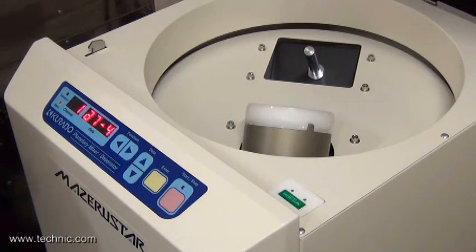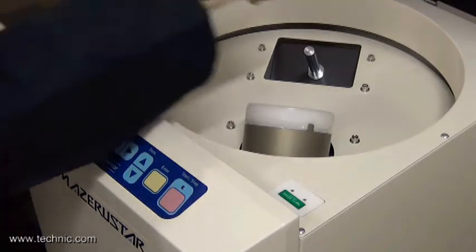We want to be sure to put the counterweights on the counterweight post. The weight will be equivalent to the net weight in the container.